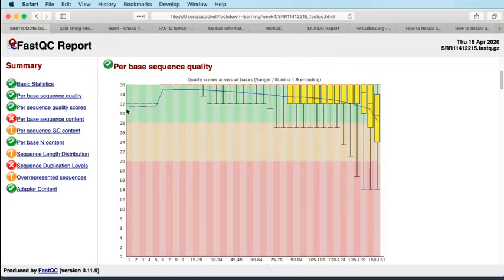And then after you've done your first 5 or 6 cycles, the quality jumps up, and then gradually over the length of the read, the quality will drift slightly downwards. And that's to do with, as your reads get longer, your clusters get out of phase, and your surety of your base calls gets lower, so your quality will drop off slowly, and that is a feature of Illumina sequencing, and you always see it.